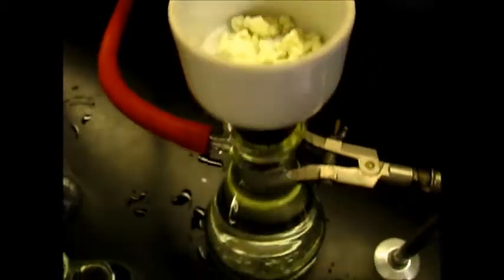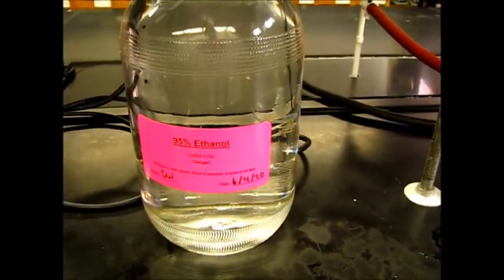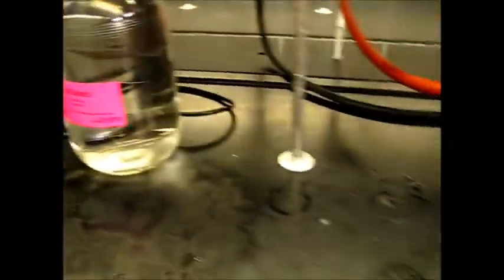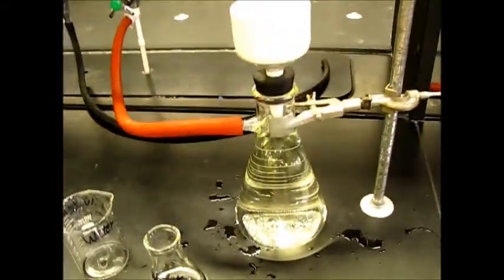Here we have our crude product, so we are going to recrystallize with 95 percent ethanol.